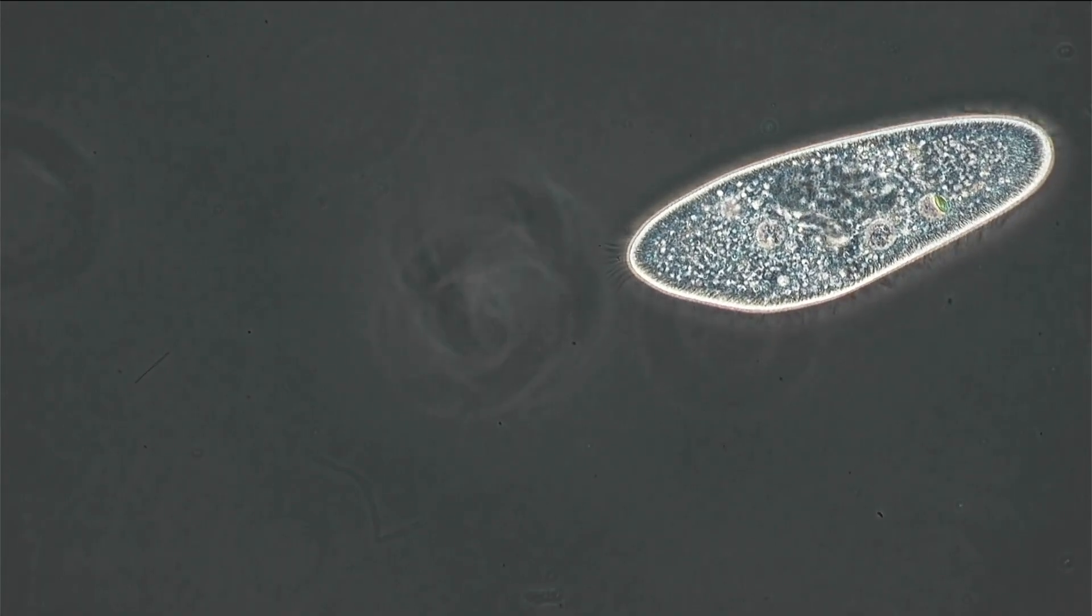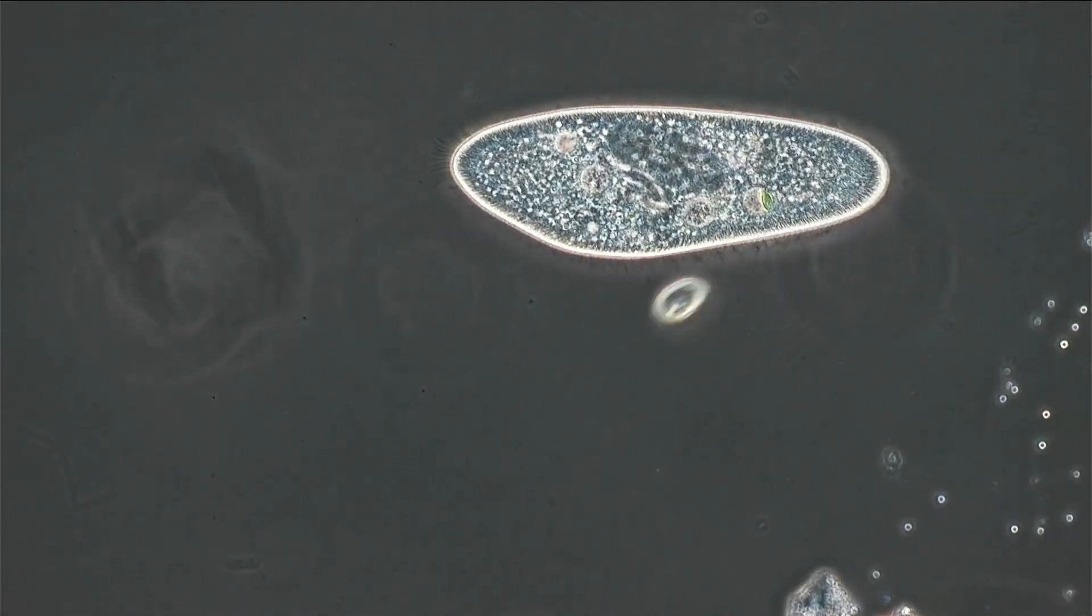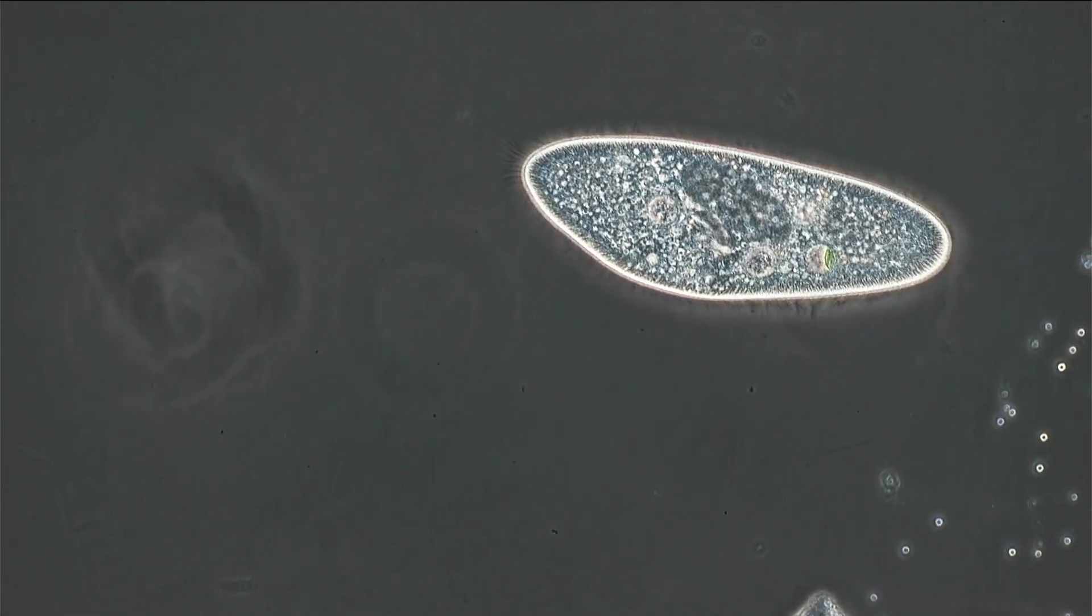But generally, that's usually the first thing that I try out is I try to limit the amount of water. And this basically also gives an overall, sometimes an overall better image simply because the cell is not able to swim up and down. It's always staying in the same level and basically everything is in focus. So you have a lot of control basically over there when you make videos or pictures.